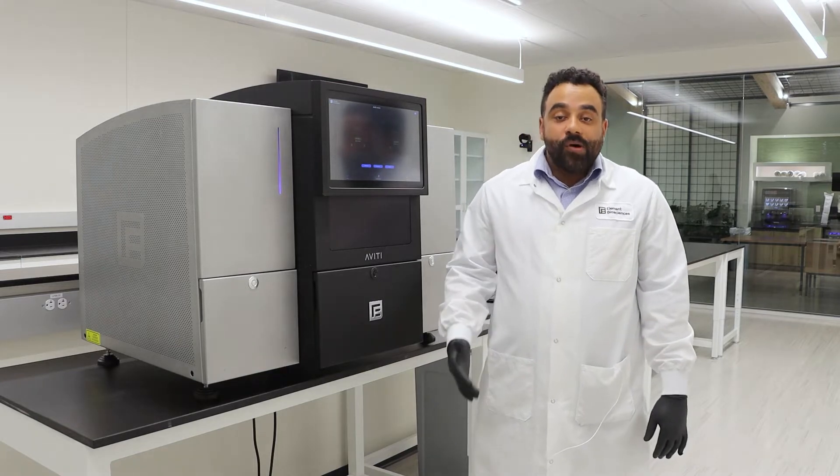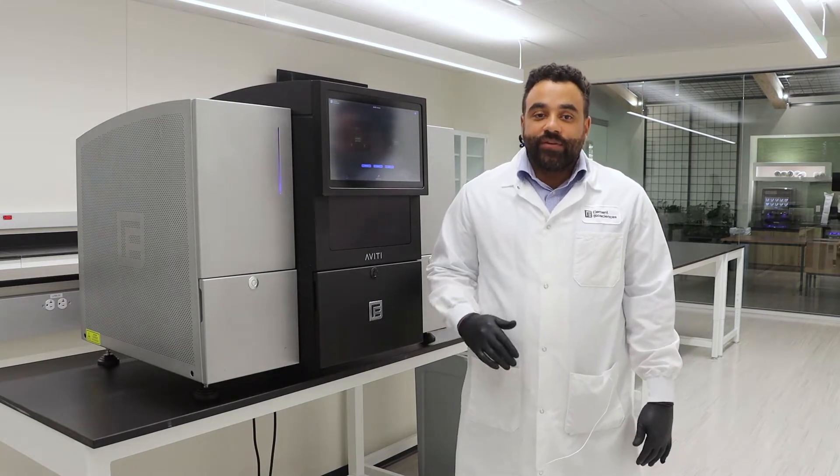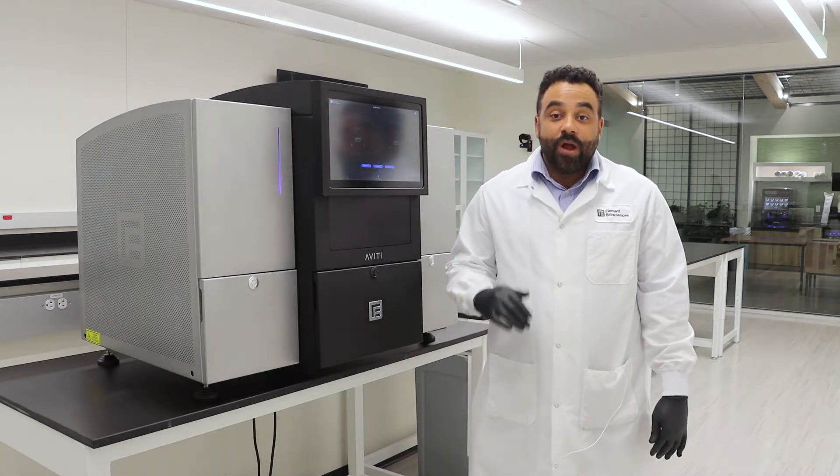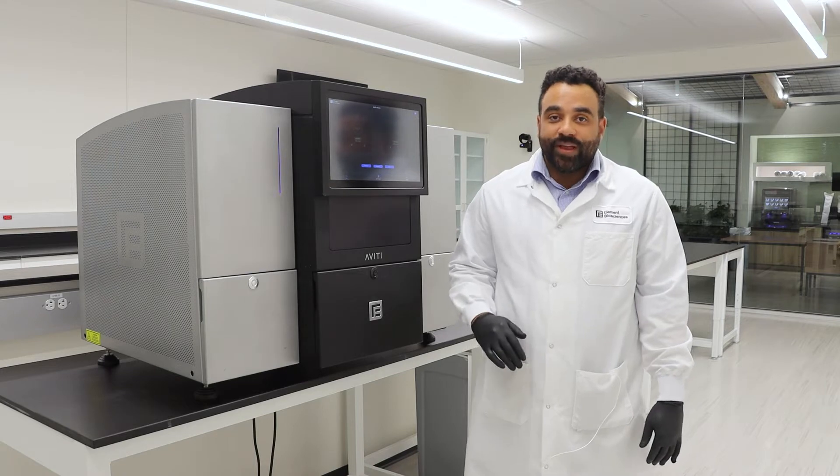From the demo, you will see how quickly you can train even your newest staff members to prepare and run the instrument properly.